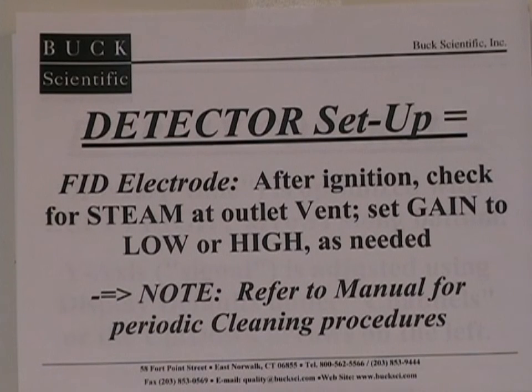Remember to always check your FID after ignition to make sure that there is steam present at the outlet vent, and it is recommended to start with a gain of low initially, and increase to high as needed to maximize sensitivity and response. With headspace GC, cleaning of the FID is usually not an issue.